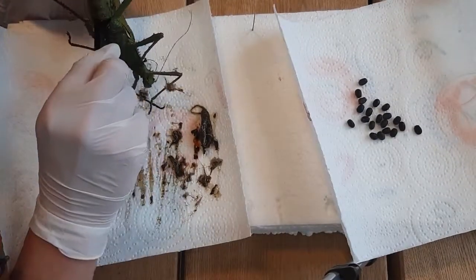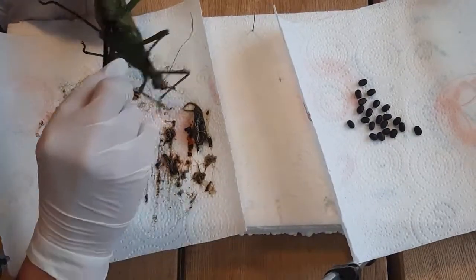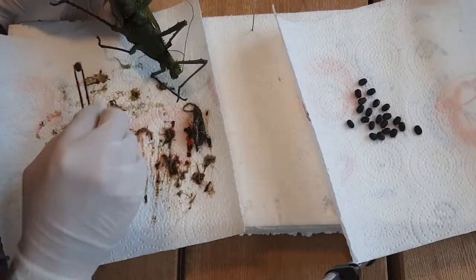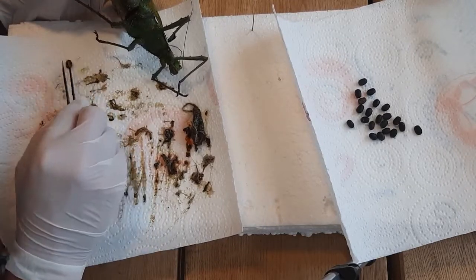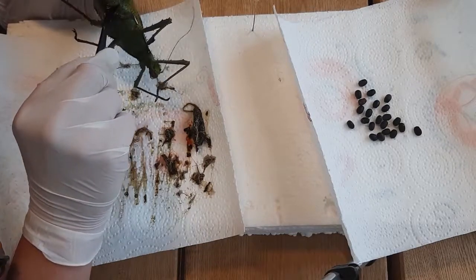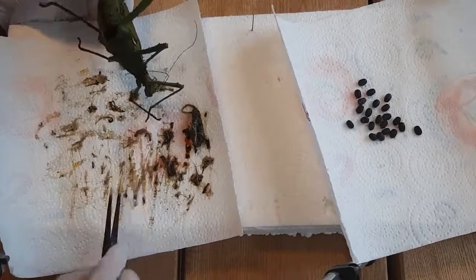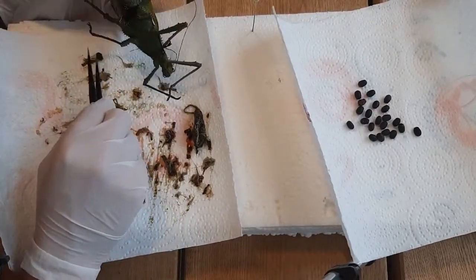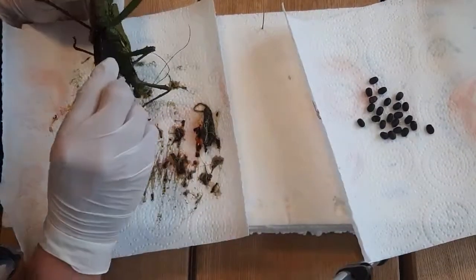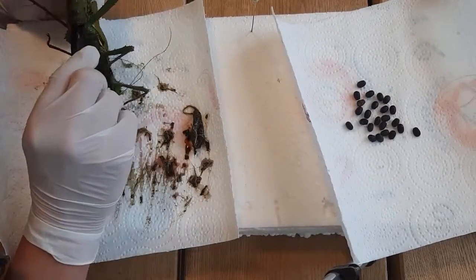One thing to keep in mind is that the inside of the stick insect doesn't only have eggs, muscles, and organ tissue — there are also pigments. The green color you see is not in the exoskeleton; it's underneath the exoskeleton, on the very outer layer of the inside. So if you go inside with sharp tweezers and scratch the surface on the inside, the pigments there will be gone — you scrape them off. You need to be very careful with that as well.